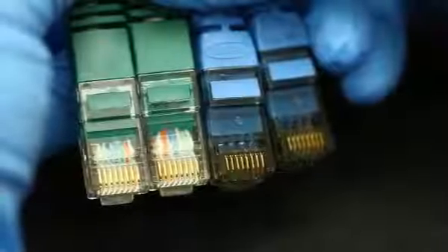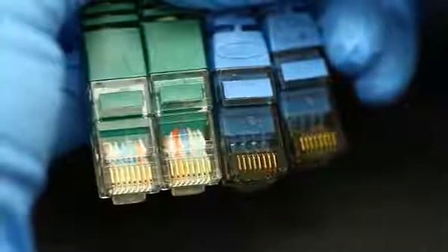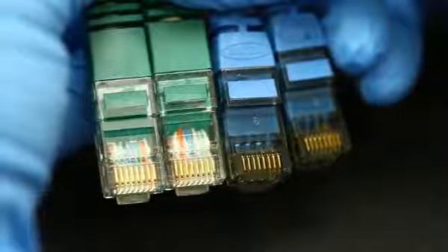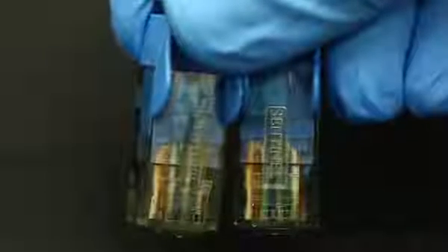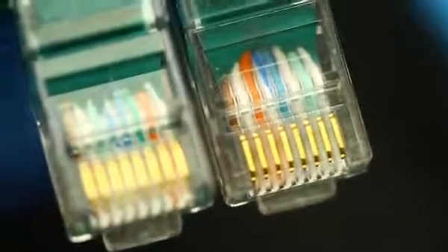To check if your cable is a standard or crossover, simply look at the two ends of the cable from the same side of the connector. If the two ends have the same color pattern left to right, it's a standard network cable. If the orange and green wires change position, it's a crossover.